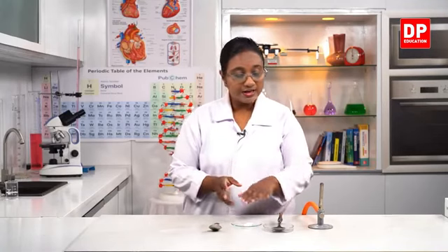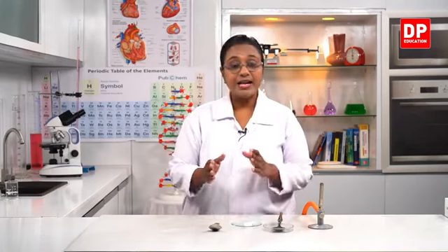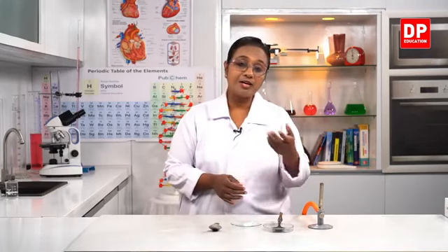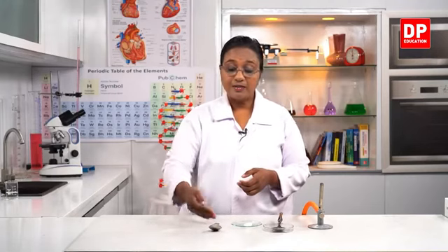So what happened here? Initially, this is the solid naphthalene or the mothball. Then when I put it onto the hot spoon, the solid mothball, the solid naphthalene, became liquid naphthalene, and thereafter from the liquid naphthalene there was vapor of naphthalene escaping because of the high temperature. When I closed it with the second spoon, the vaporized naphthalene again became solid on the spoon. So it condensed not to a liquid state, but it solidified. The naphthalene vapor solidified on the spoon.